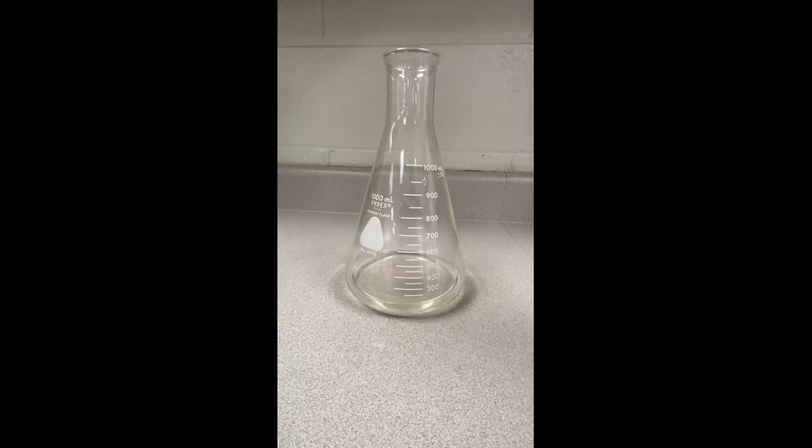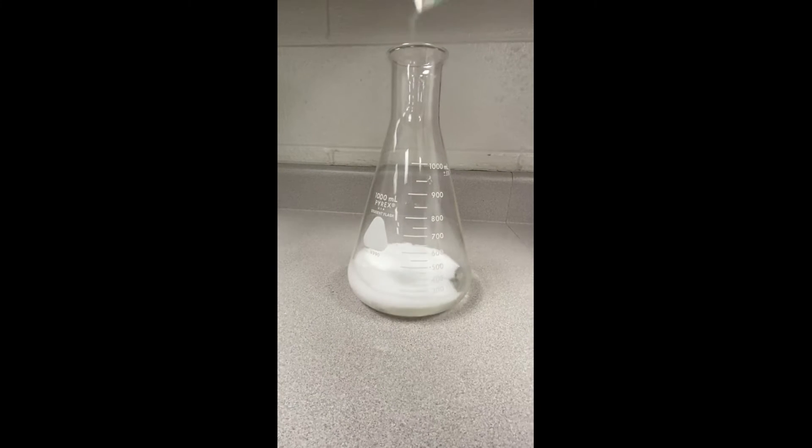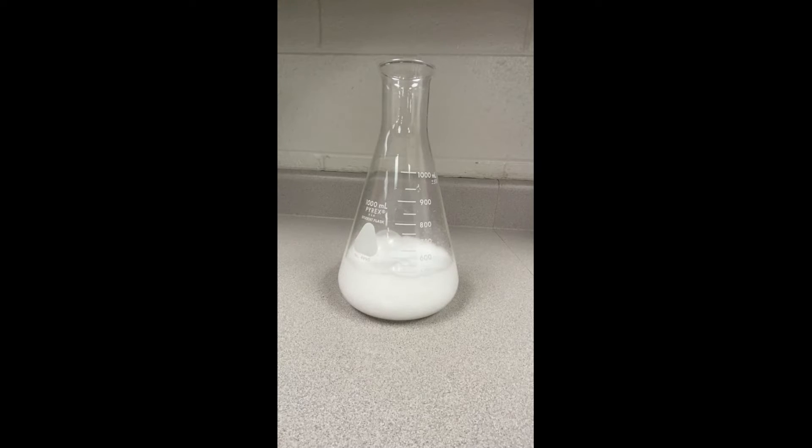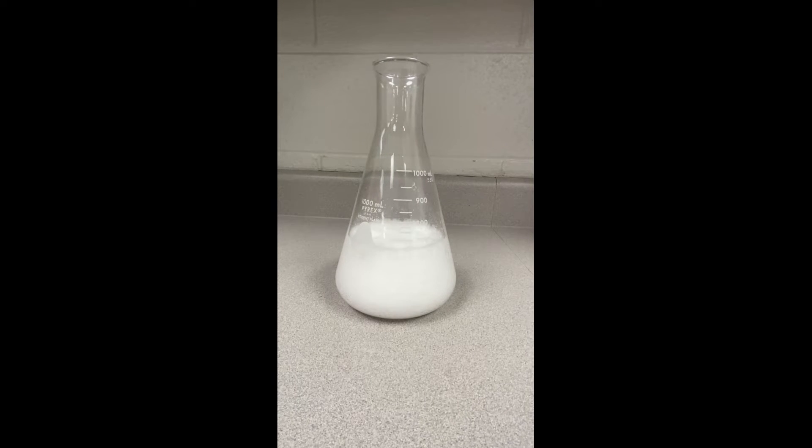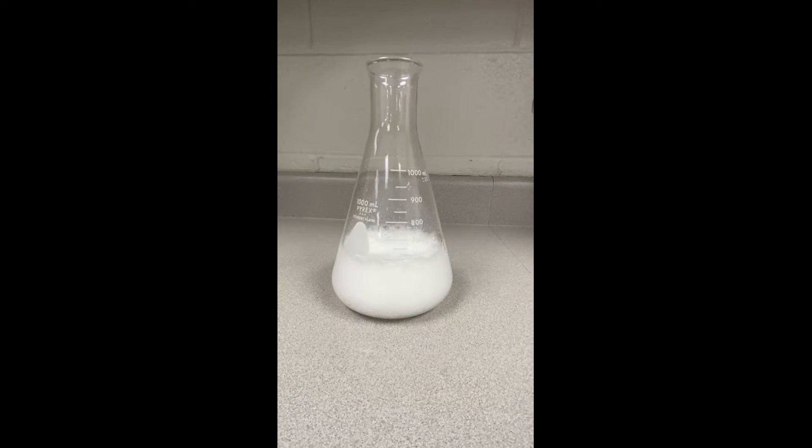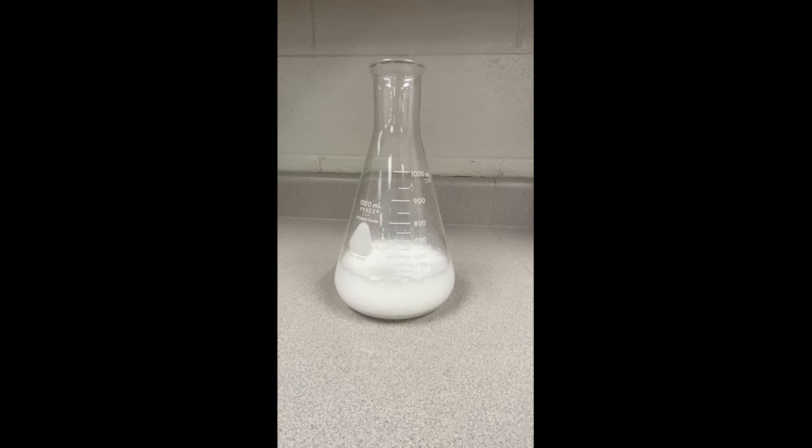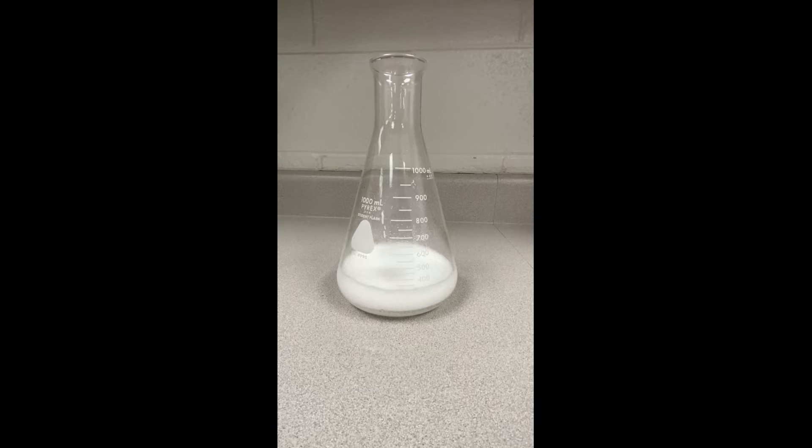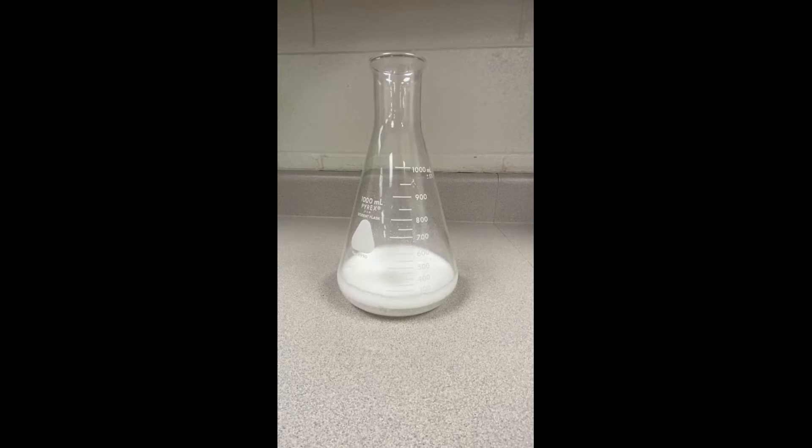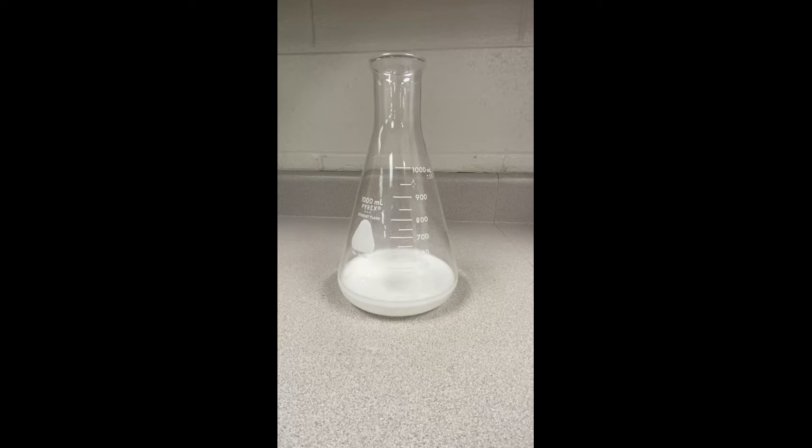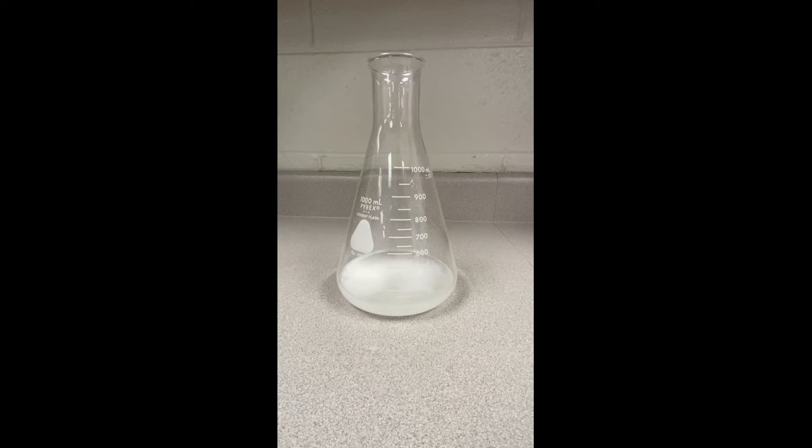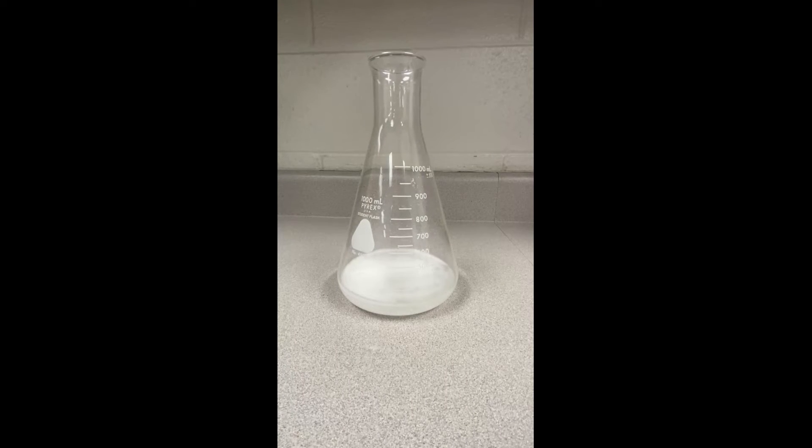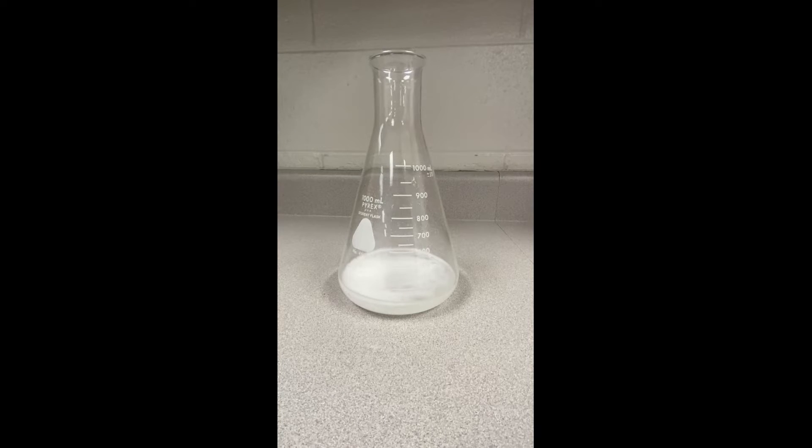Now we're going to perform our experiment. We're going to put the baking soda inside our flask. Watch it bubble, fizz, and foam up. You can see this is an open system so there's no lid or seal on the top. All of the gases are leaving the system and going out into the air surrounding it. You can see that we're waiting, giving it time to fully stop fizzing and foaming here at the bottom in order for us to take its final mass.